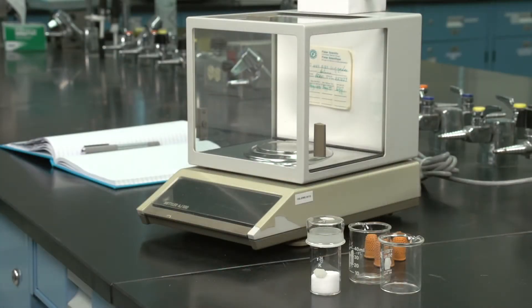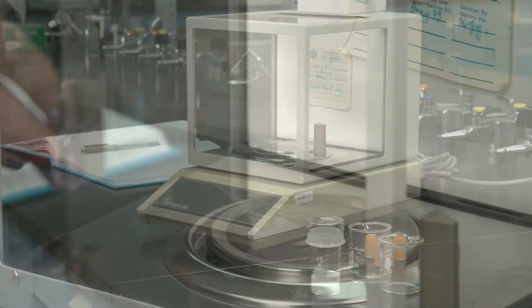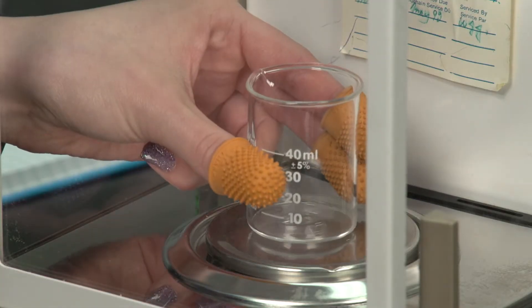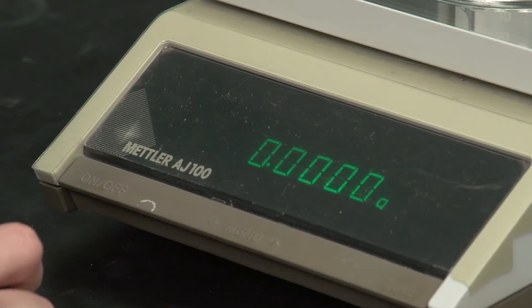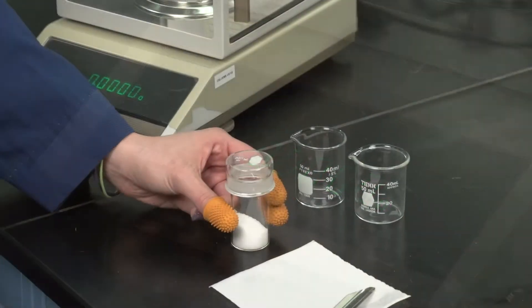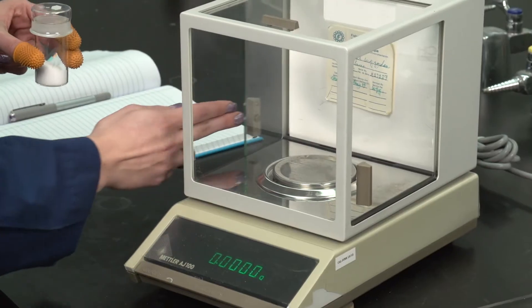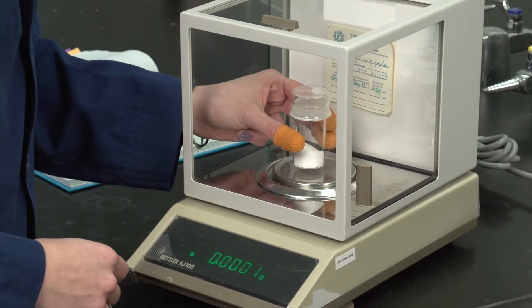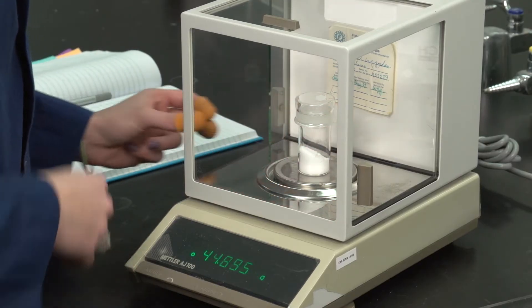Weighing by addition or weighing by addition with tare is a weighing method in which the empty receiving vessel is tared or put to zero mass on the balance and a bulk sample is added to the required mass. This technique is useful when single samples are required.